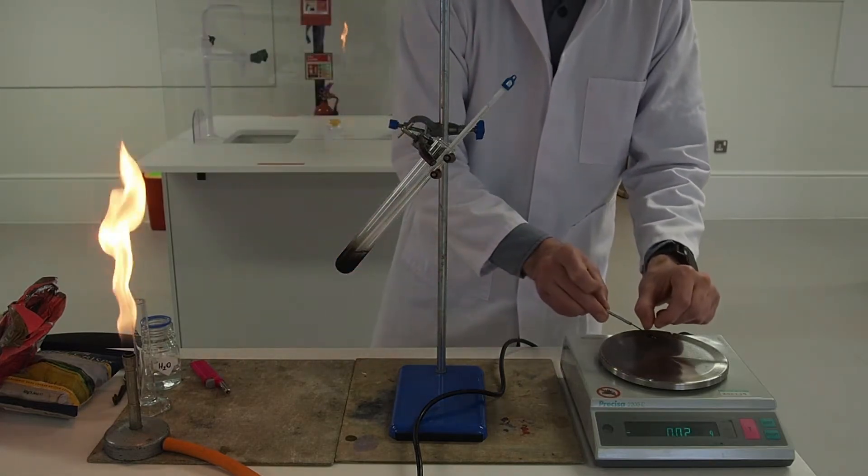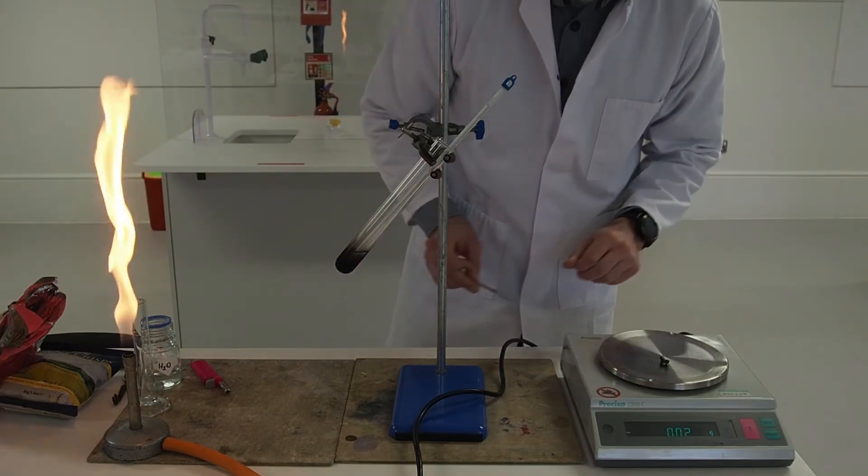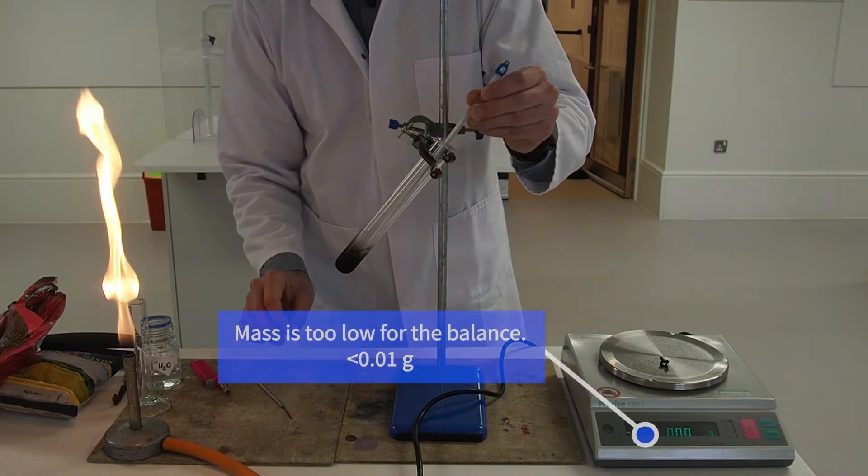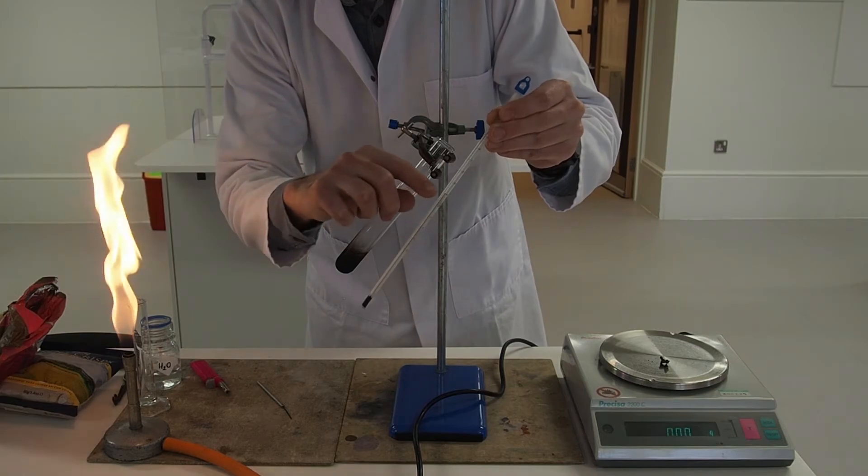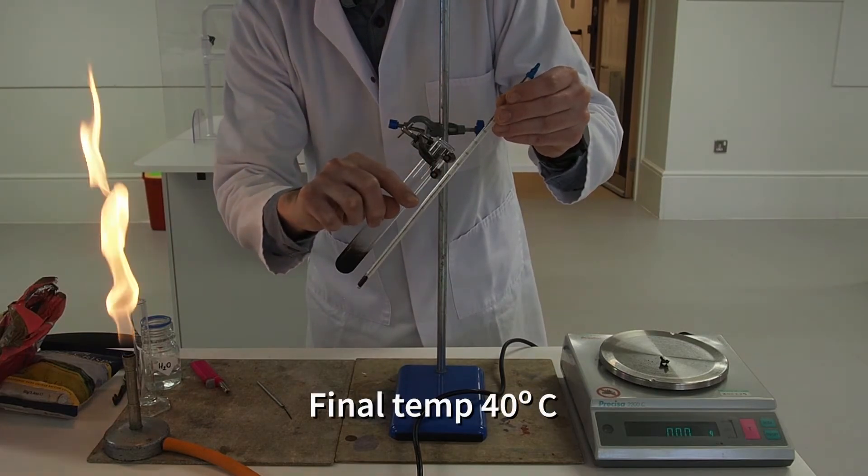Once the food is completely burnt we weigh it again to determine how much of it was burned in fire. And we quickly note the temperature of the water again. The final temperature was 40 degrees centigrade.